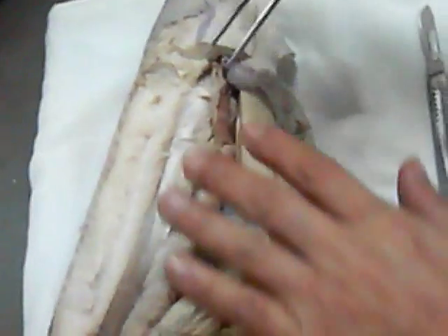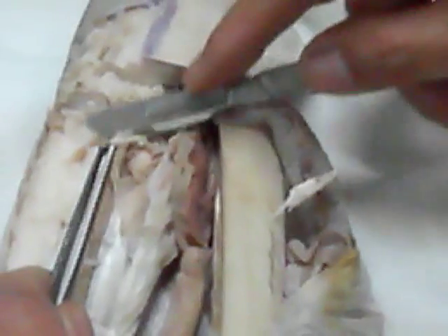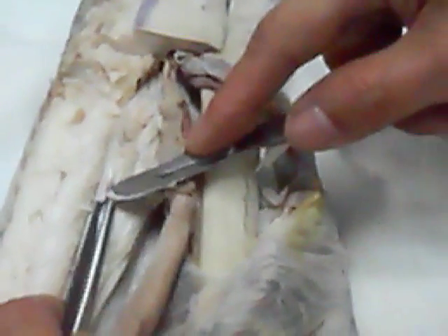So now try to cut more. Try to remove the parietal peritoneum, because the kidney is covered by the parietal peritoneum. And you don't call the kidney of the shark 'kidney' — you call it opisthonephros, because the kidney is very primitive.